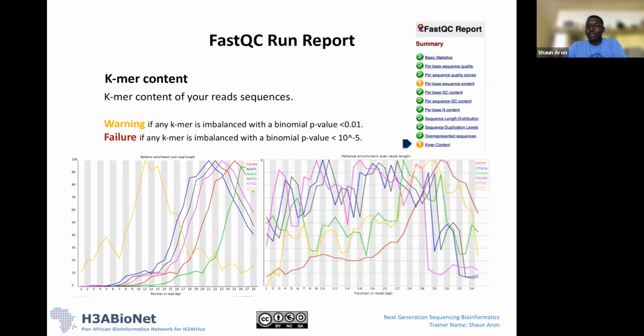This can also get a bit messy. I tend not to use these results too strictly, unless it's something very obvious. Like for example, here we're getting these similar patterns for all these k-mers across a particular part of our read. Then that's quite obvious. But it can be a bit misleading. So I would suggest that you play around with this. Don't interpret this too much.